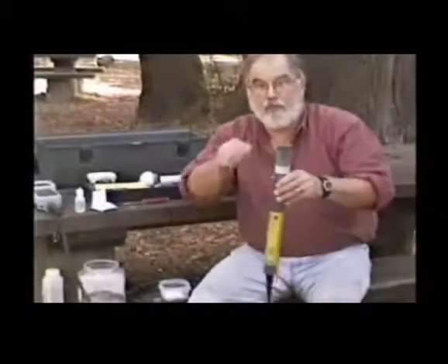Now the instrument is not ready to use now, even though I installed the membrane. The membrane, being flexible Teflon, has to kind of relax after it's installed. You saw how I stretched it. So it takes between 6 and 8 hours to relax. So the instrument should not be used for at least 6 or 8 hours until that membrane is allowed to relax. And then it can be calibrated and used in the field.